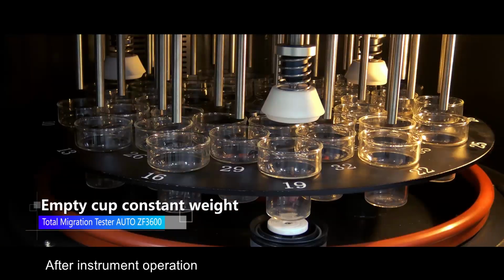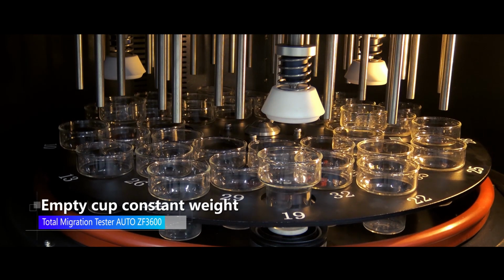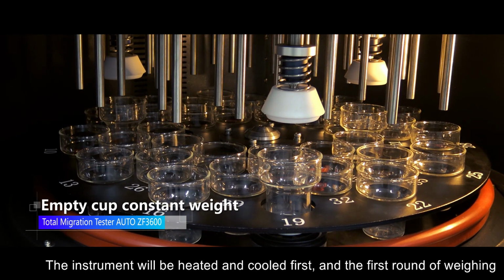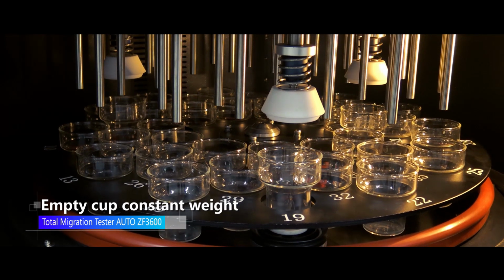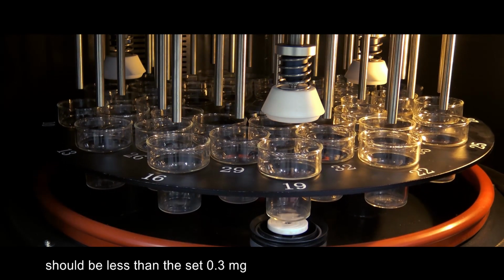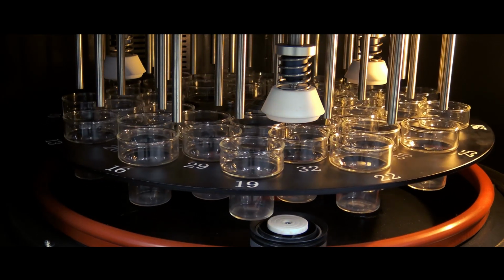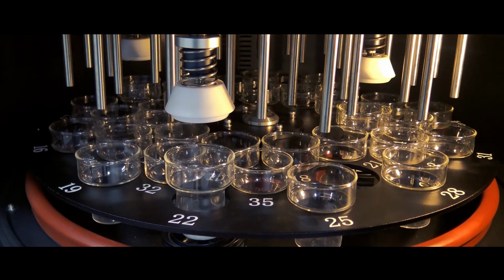After the instrument starts operating, the first step is the empty cup constant weight process. The instrument will heat and cool first, then do the first round of weighing. Then it repeats heating and cooling for the second round of weighing. The mass difference between the two weighings should be less than the set 0.3 milligrams. Then it performs the next step of the process.